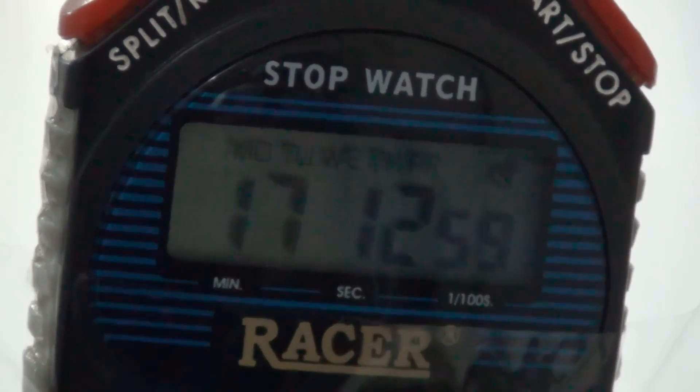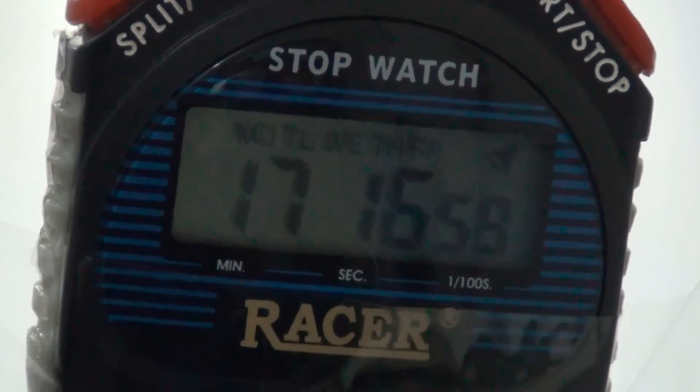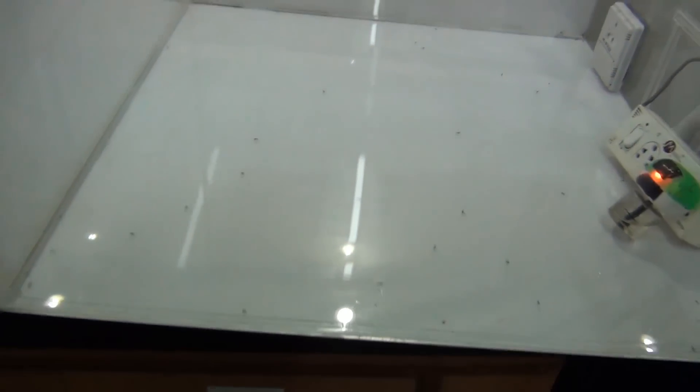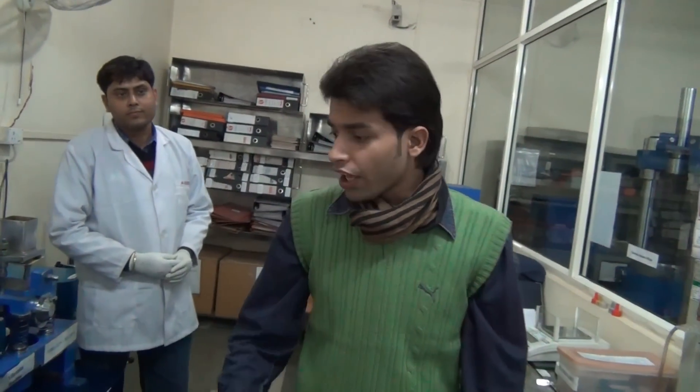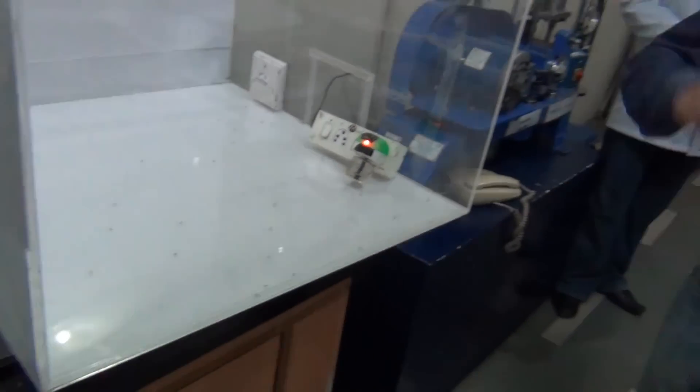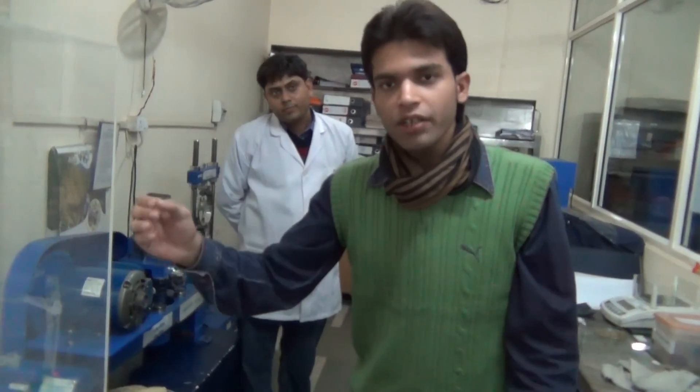Now, as our test is on — we had 30 mosquitoes in the chamber — the mosquito repellent has been on for 17 minutes and now 20 mosquitoes have been knocked down. As you can see in the glass container, we had put approximately 30 mosquitoes. My 20 minutes have not been completed yet and about 28 mosquitoes have been knocked down. We have tested it according to our standard. Our consumer lab test for mosquito repellent — we tested it at 50% of the liquid, and when it comes to 50% of the liquid, it is effective. Almost every mosquito has been knocked down.